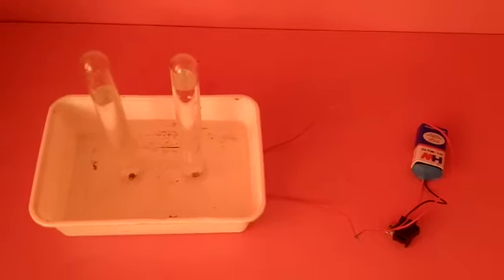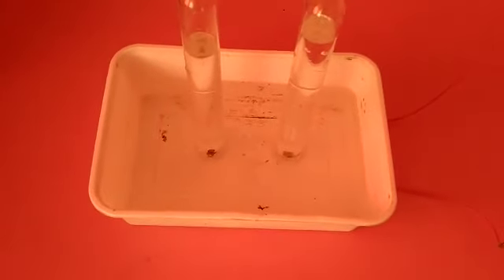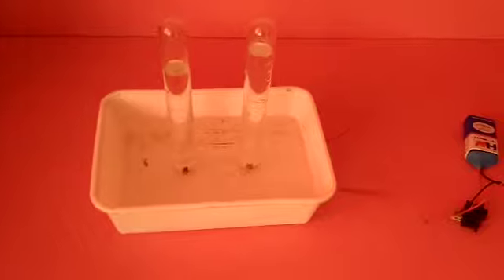Using these things, make a setup like this and pour some pure water inside the box and fill some water inside the test tubes.